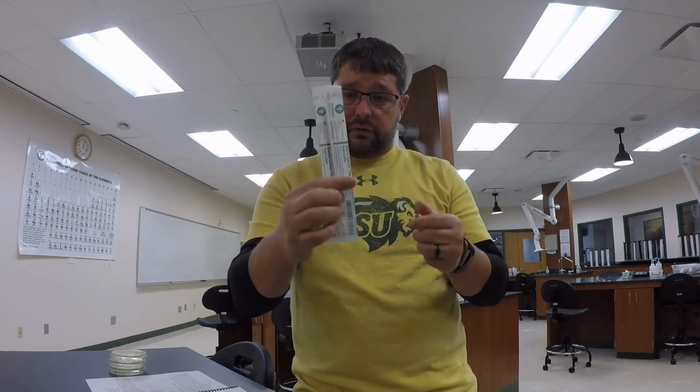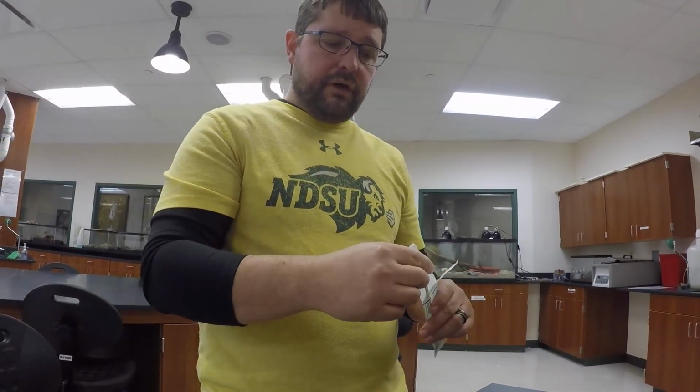The next one is I'm going to choose 2 environments to swab. Okay, and then I'm going to inoculate those dishes. So I'm going to use 2 sterile cotton swabs. Okay. So I'm going to open the cotton swab, and what I want to do is I need to get this cotton swab wet. Okay. So what I'm going to do is I'm going to use just a little bit of regular sink water to get the cotton swab wet, and then maybe I'm interested in swabbing a certain object.